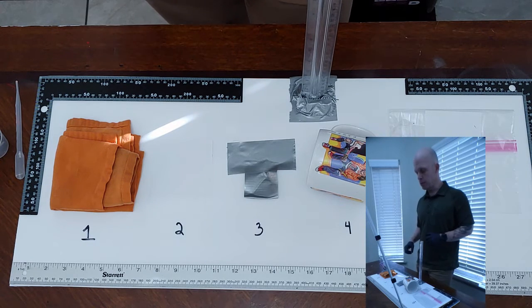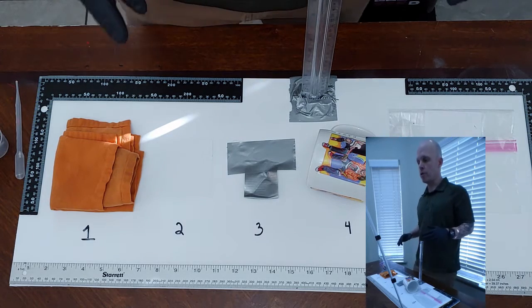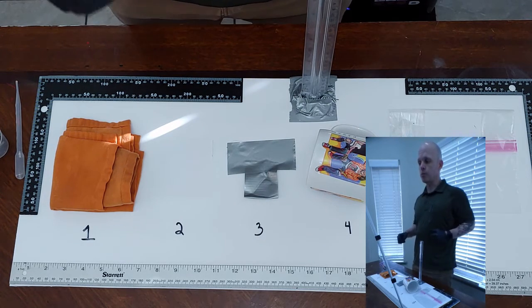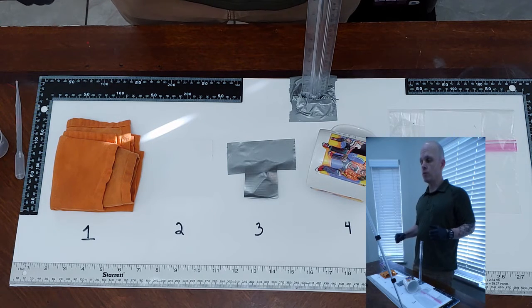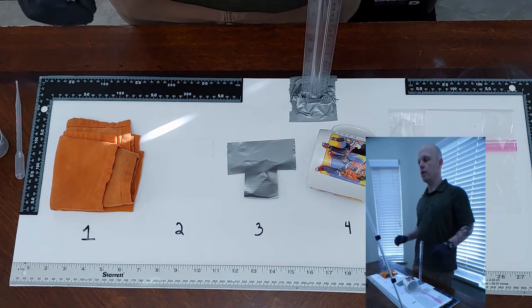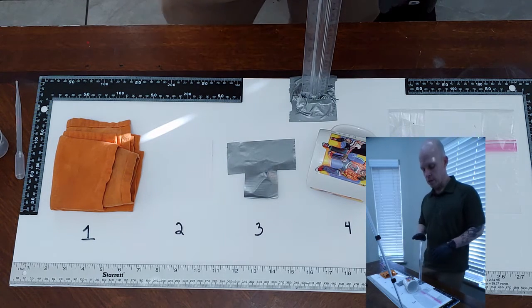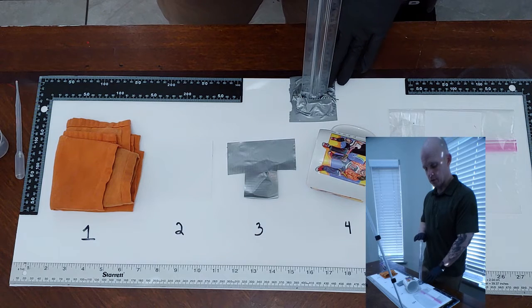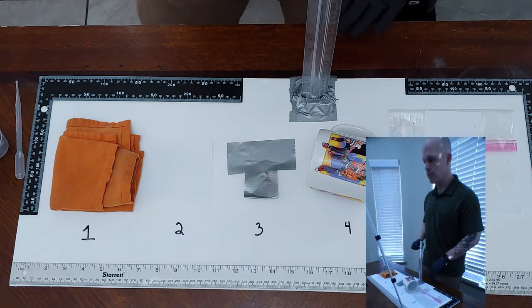So normally when somebody's bleeding, they're not going to just stay stationary in one place. They're going to be running around or moving. So sometimes you'll see a drip trail that moves from one point to another in a room. And then drip stains can also be measured to tell the approximate height that they fell from. So we're going to look at blood drip stains from 1 foot off the ground. So we have our ruler here in place, so 12 inches off the ground. They're going to be falling perpendicular.